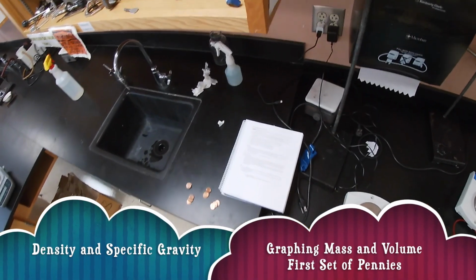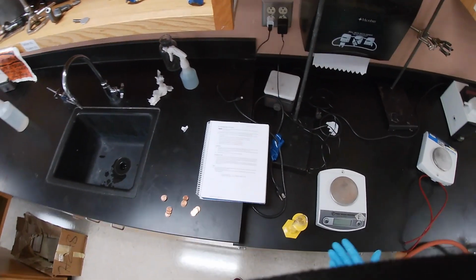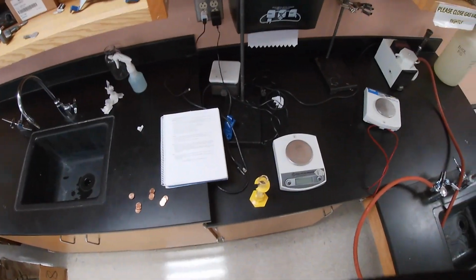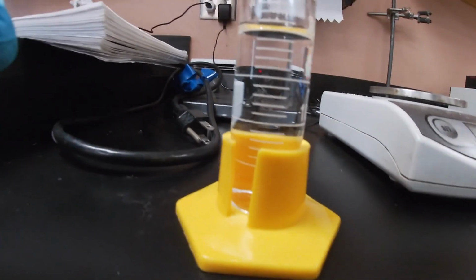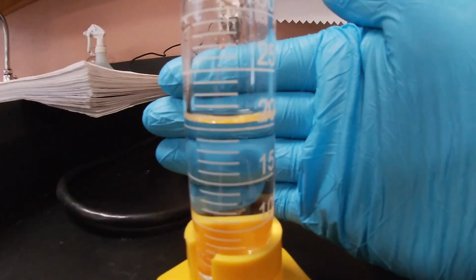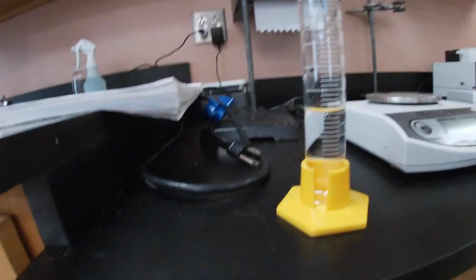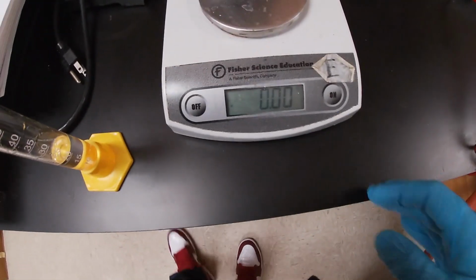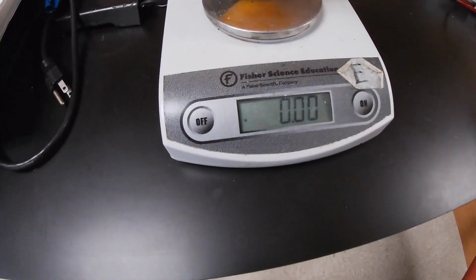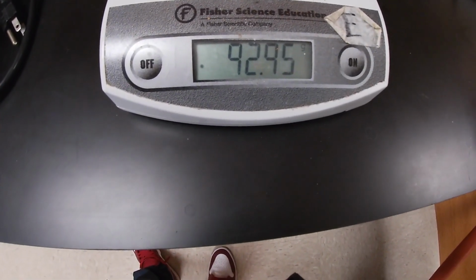For part D, the density and specific gravity, we're going to measure out a certain amount of volume into a graduated cylinder, and as you can see, I've given the amount to be approximately 20 milliliters. Now we're going to get the mass, so we turn on our scale. We get the mass of the graduated cylinder and the water, and it's 92.95.